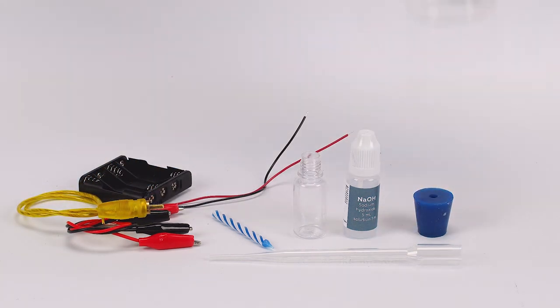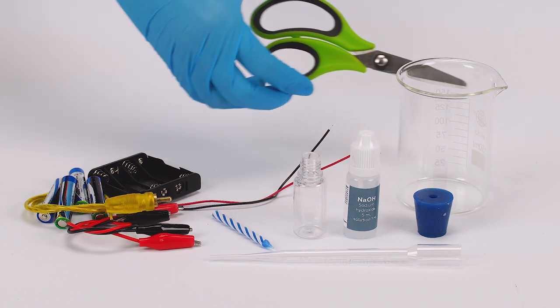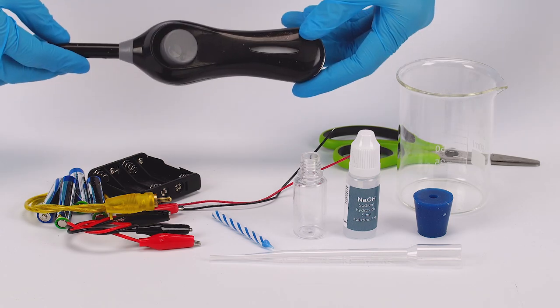Take the rubber stopper with one hole and the beaker from the starter kit. Also prepare four AAA batteries, scissors, and matches or a lighter in advance.